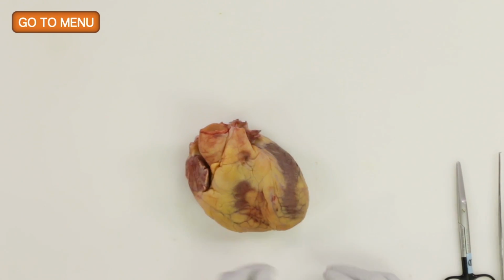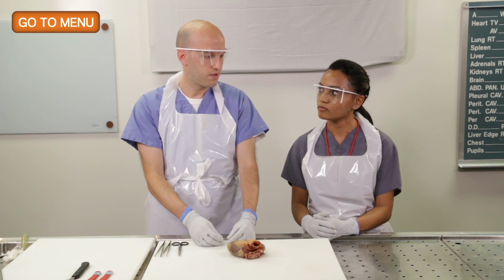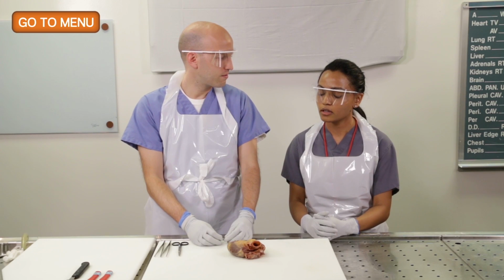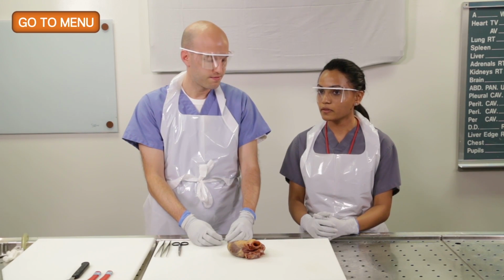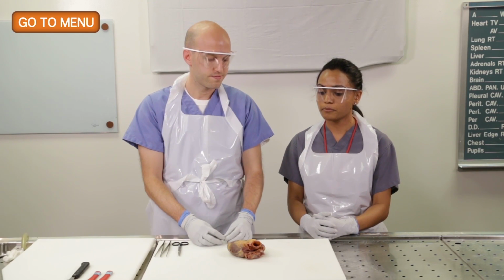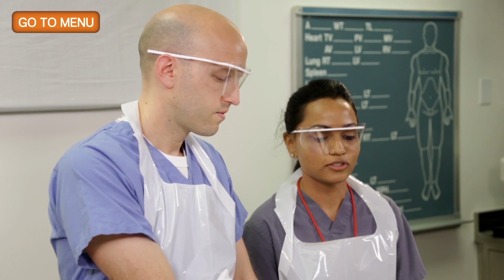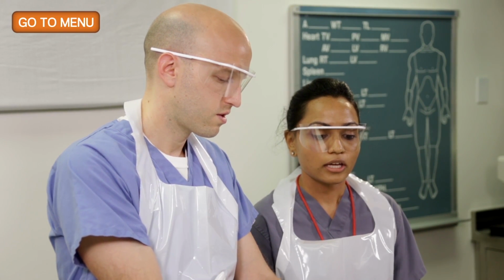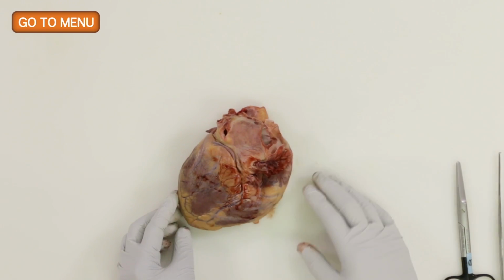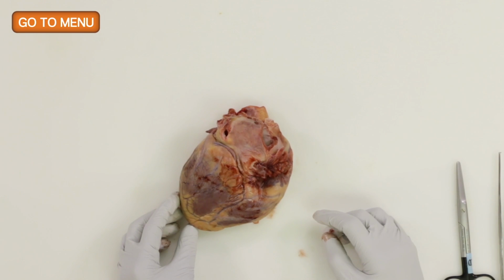And how do we tell if a heart is right dominant, left dominant, or co-dominant in its coronary circulation? The artery that supplies the posterior descending artery is basically what decides the coronary circulation dominance. If the right coronary artery supplied the posterior descending artery, then we would call it a right dominant heart.